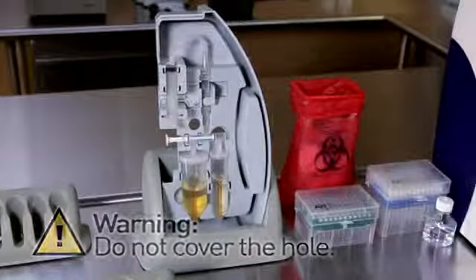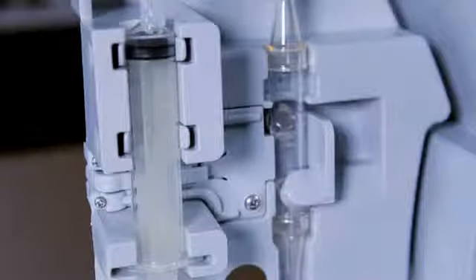To engage your magnets, slide the magnet holder to the left until it locks. You'll hear a click. This positions the magnet against the capture chamber.